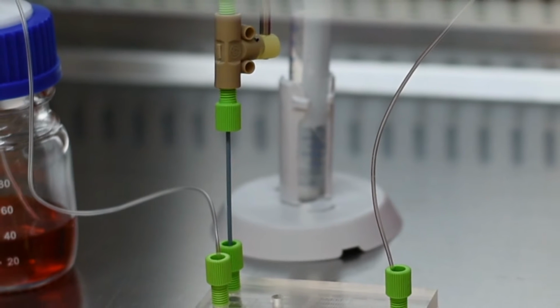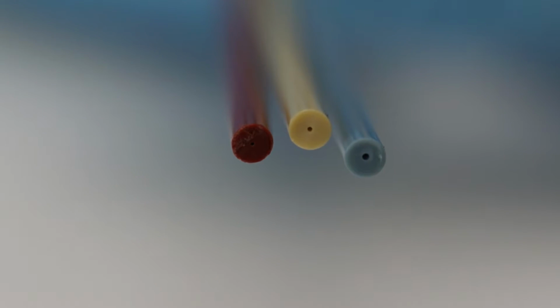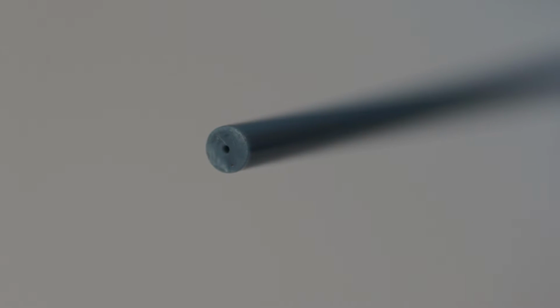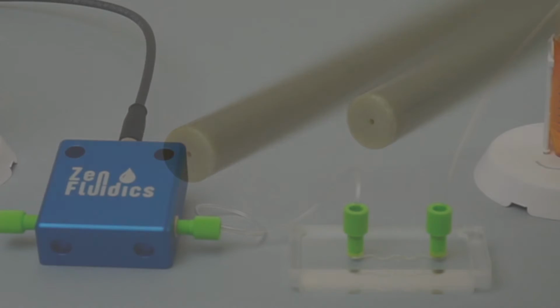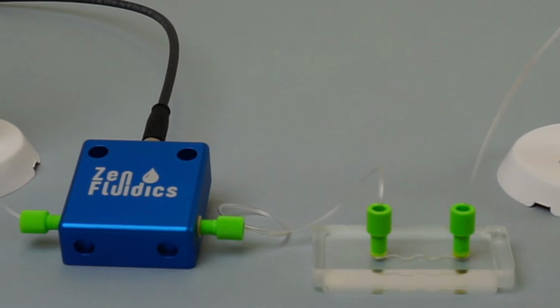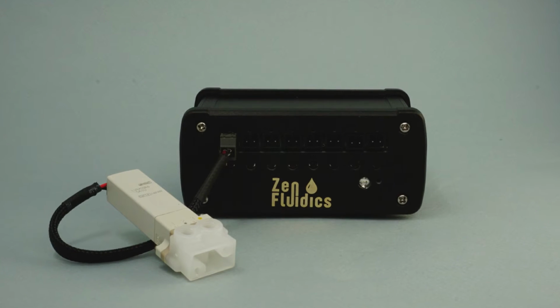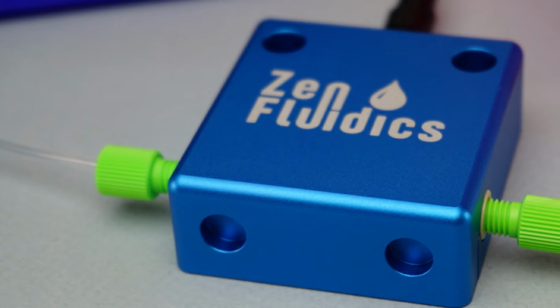In conclusion, the use of a flow restrictor can adjust the working values to the ideal values for a given assay, from picoliters to milliliters per minute. The selection of the flow restrictor depends on the overall resistance of the system, which may include additional components to the ones shown in this tutorial, such as interconnecting components, microfluidic chips, sensors, and several others.